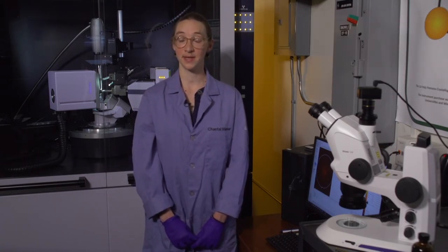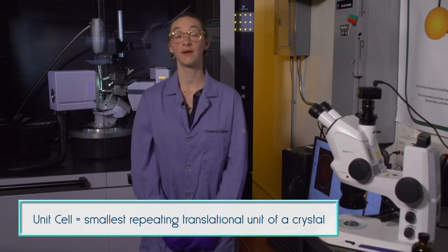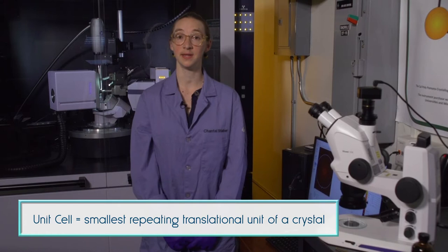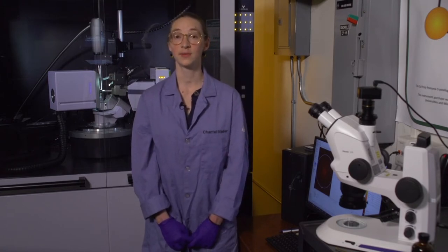The next step is to determine the unit cell of the crystal. The unit cell is the smallest repeating translational unit of the crystal and will help determine how much data needs to be collected. The unit cell is determined by collecting data at several angles or positions of the crystal in 3D space.